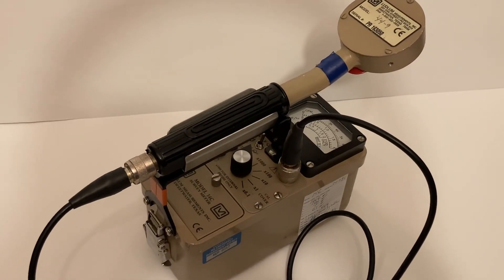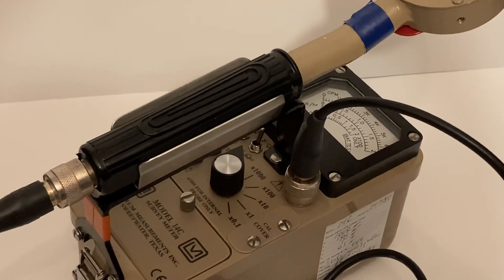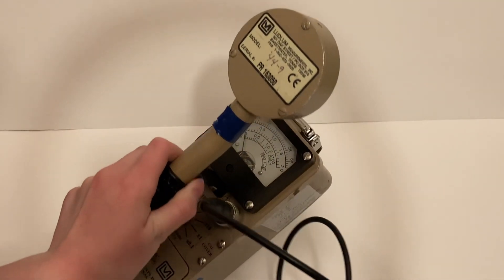In this video, we will be covering the use of the Ludlum Measurements Model 14C General Purpose Survey Meter. The unit is very easy to use and requires minimal training.